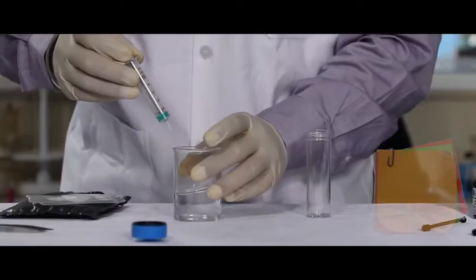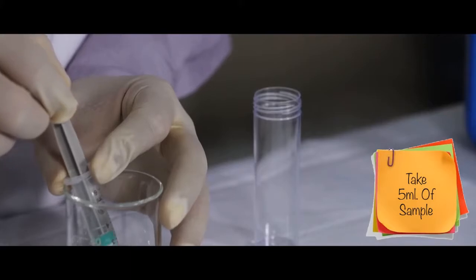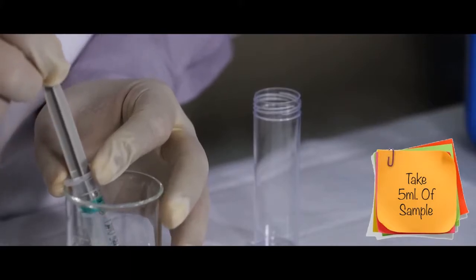Remove the cap and take 5 ml of sample in the test bottle using the syringe.